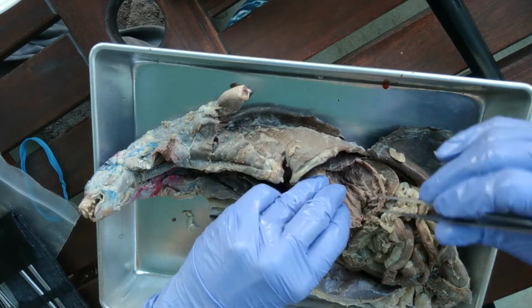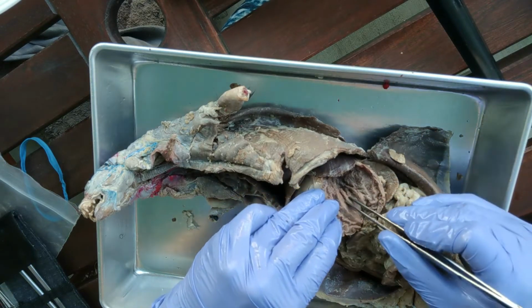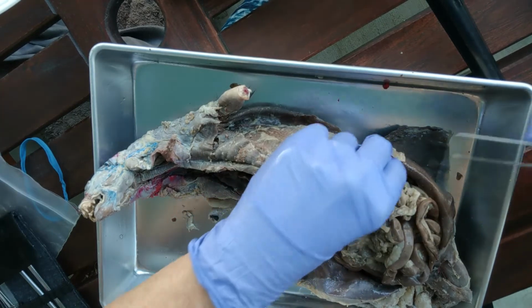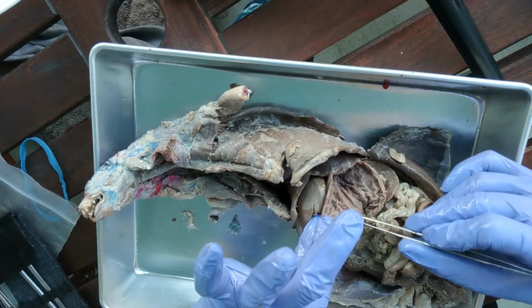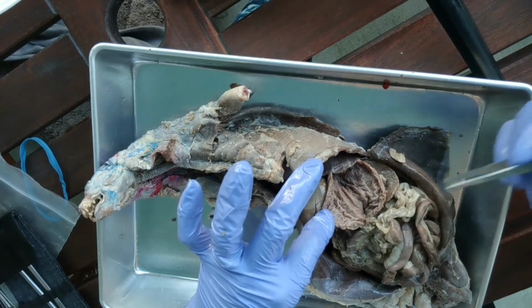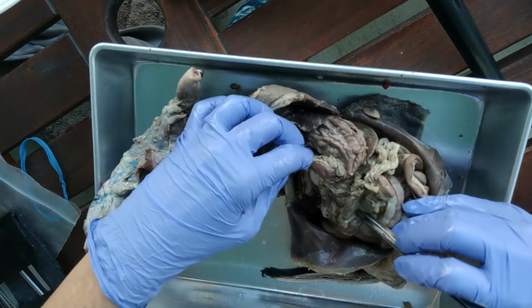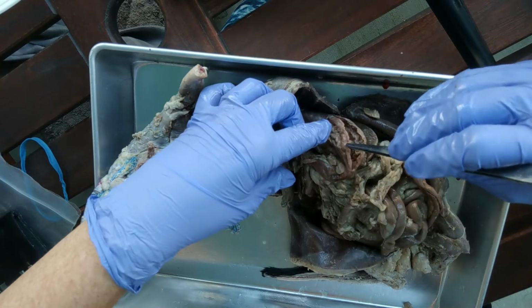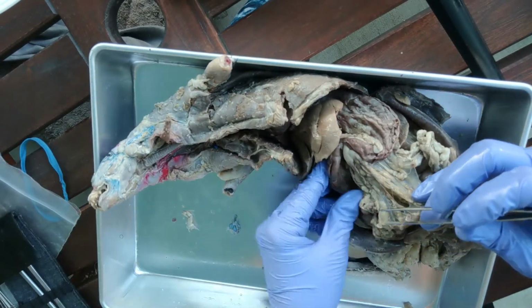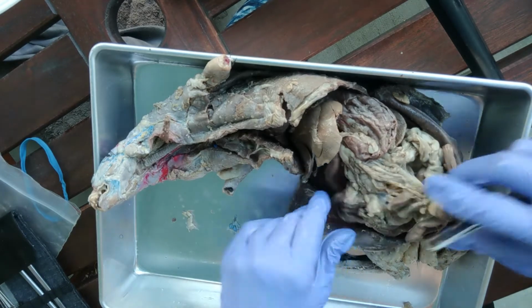So remember that for Thanksgiving Day, right? You've got a considerable expansion because of those rugae. Okay, and one interesting thing is the size of your rugae for the minks depends on whether or not the stomach was full or empty when it died. Okay, so that was the stomach. Continuing on, we have the small intestine.